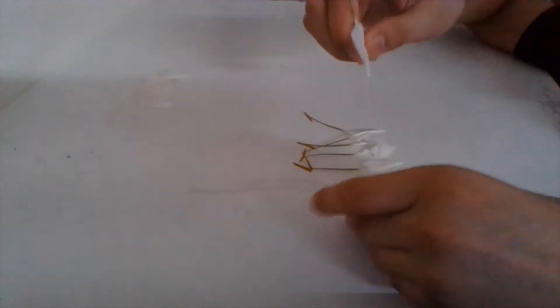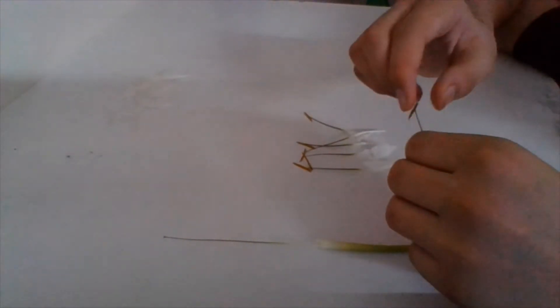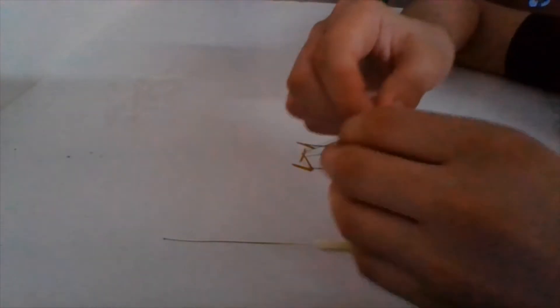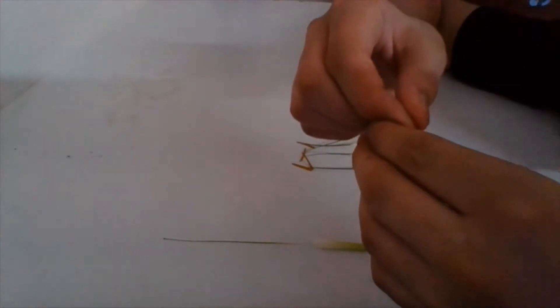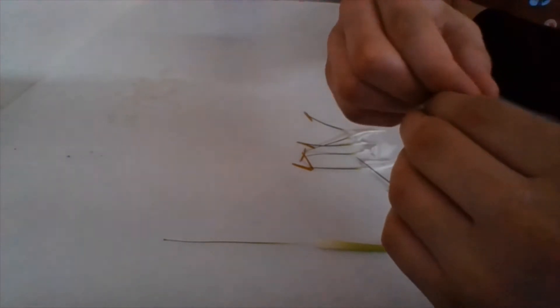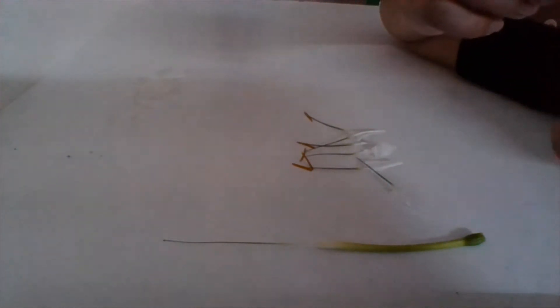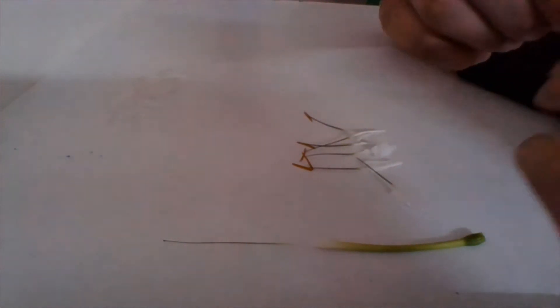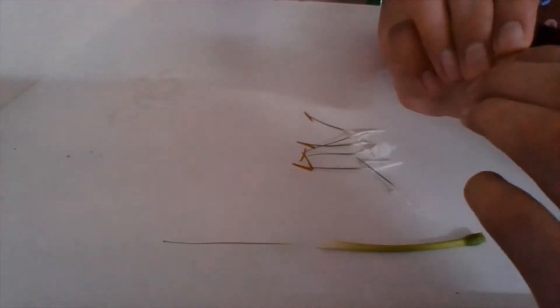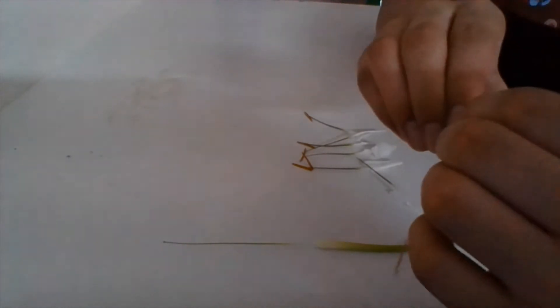Just showing the anther and the filament — this is the anther, and if you dissect it even further you will see many small powder-like things, which are the pollens. And this one is the filament.